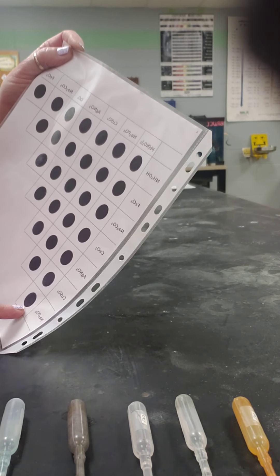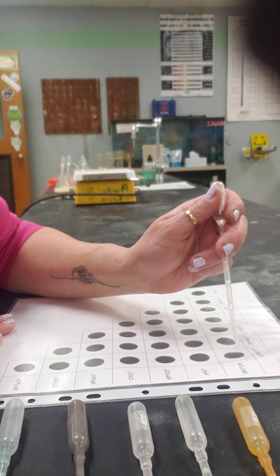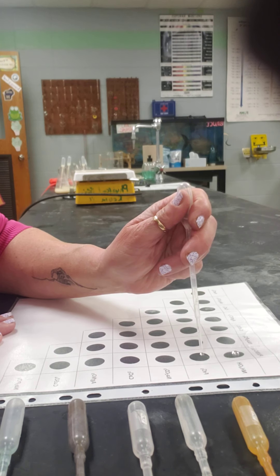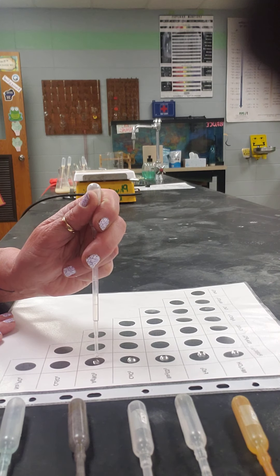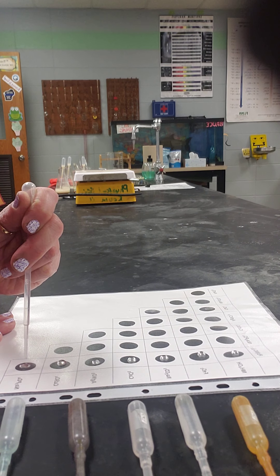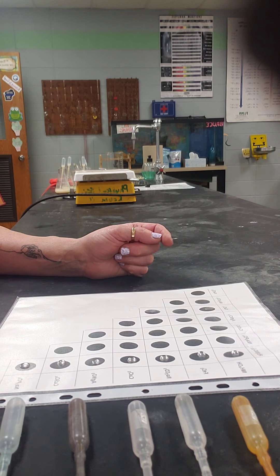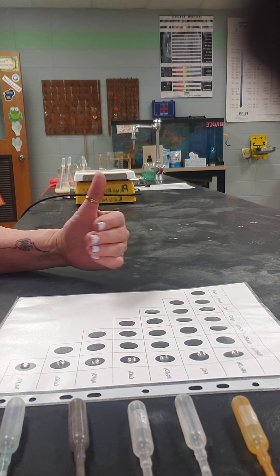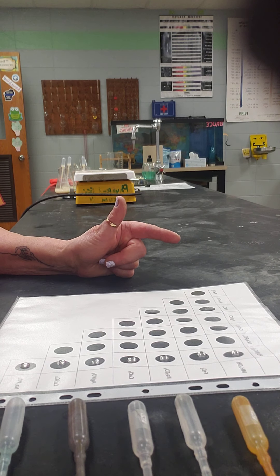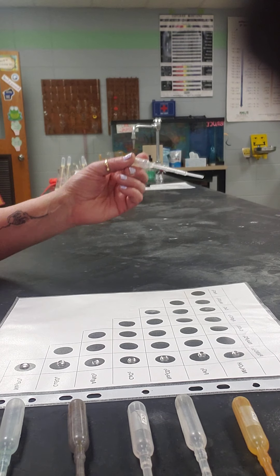Today I'm just going to do this row, reacting lead(II) nitrate with various compounds. I'm putting two drops of lead nitrate on the sheet. Those little black dots are there to help us pick out if there is a precipitate — remember, the clues of a chemical reaction are precipitate, color change, gas given off, or energy exchange. These are all going to be double displacement reactions, so we're going to see precipitates.